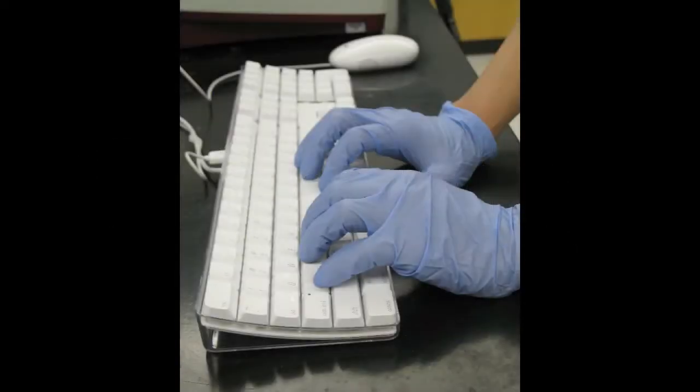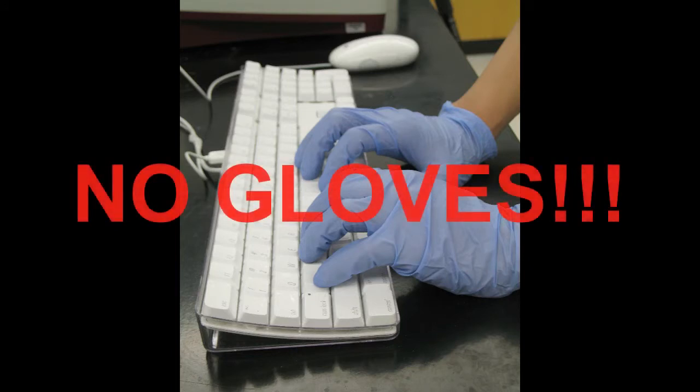The first thing to remember is never ever wear gloves when you're working with the computers anywhere in the organic labs. It's assumed that you have chemicals on those gloves, and those chemicals are going to be treated as contaminants or hazardous waste. And so if you put it on the keyboard and then someone else goes to use the keyboard and is not wearing gloves, you're going to be exposing them to those chemicals.